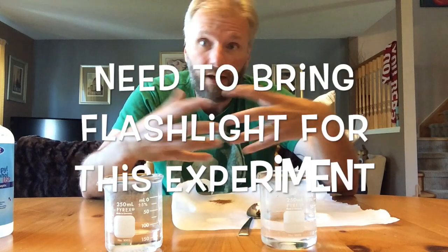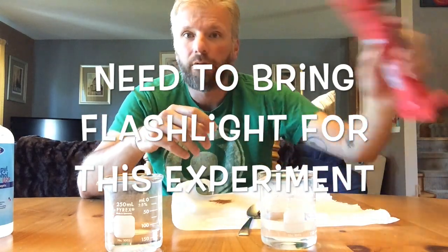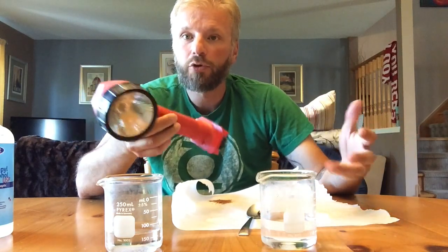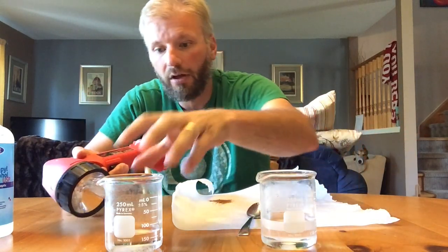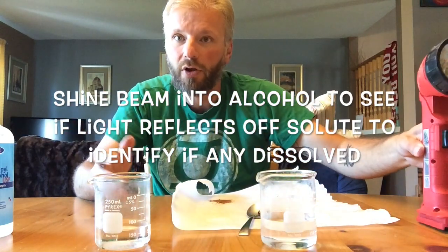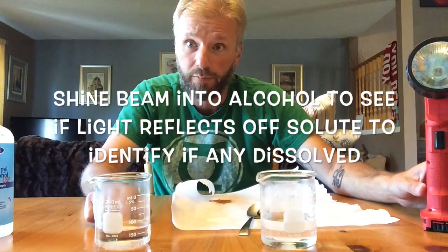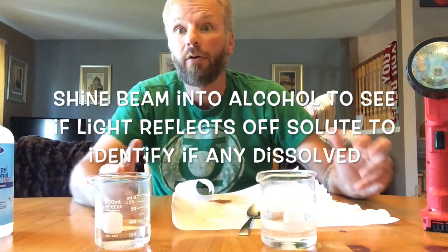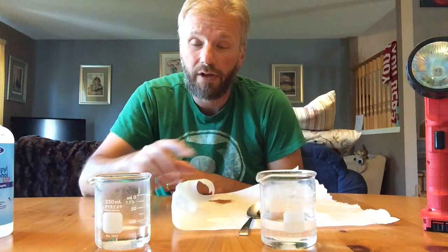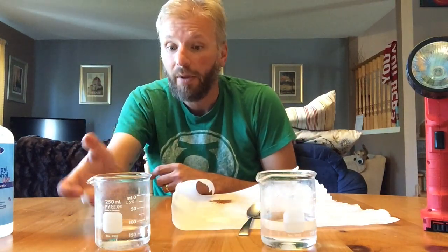For this experiment, it's critical that you bring a flashlight. Unfortunately, I can't provide flashlights for everybody, but I have a flashlight here. What you're going to do is turn your flashlight on, hit it with the beam, and really see, because if stuff hasn't dissolved, the light will reflect off the crystals. The crystals are kind of white and the water is transparent, so sometimes it's hard to see. So bring a flashlight or use your phone, get a flashlight app, and make sure you use a flashlight with this experiment.